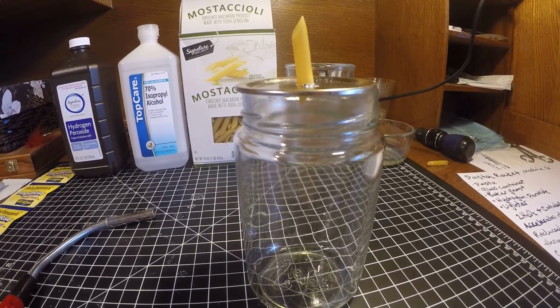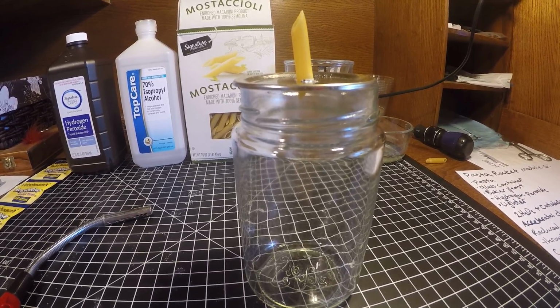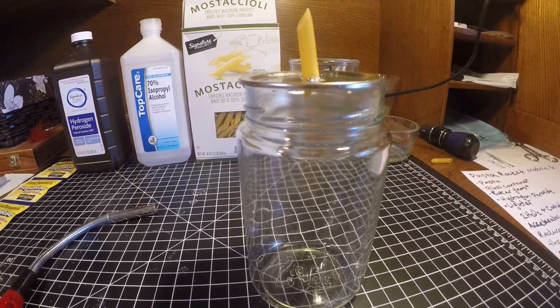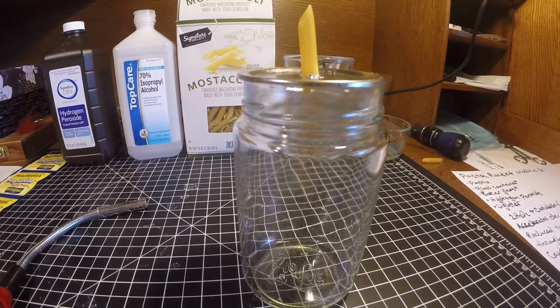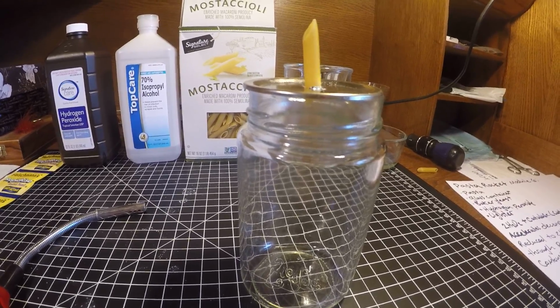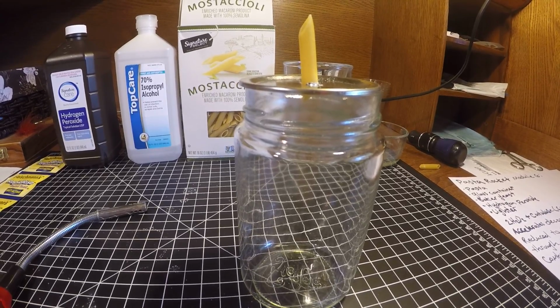As you know, you need a source of flame. You need fuel, which the pasta is, and then our accelerant. You need oxygen, and the pure oxygen being put off is going to be the accelerant, which is going to increase and should sustain a steady burn in this process.